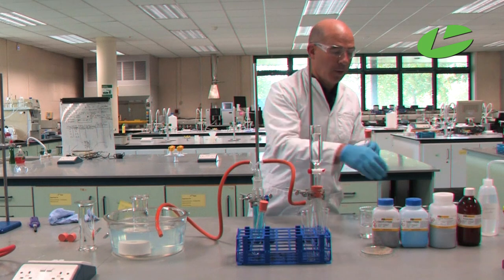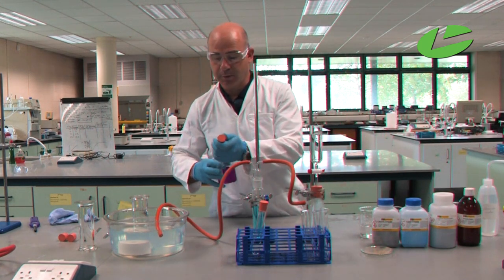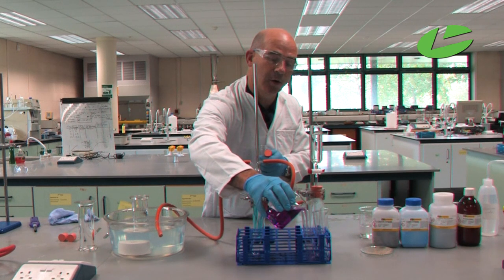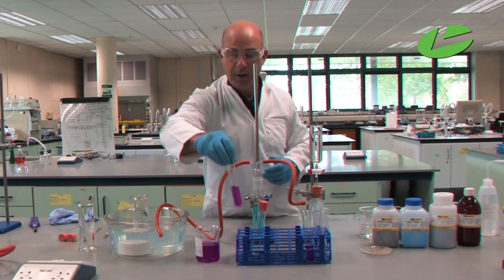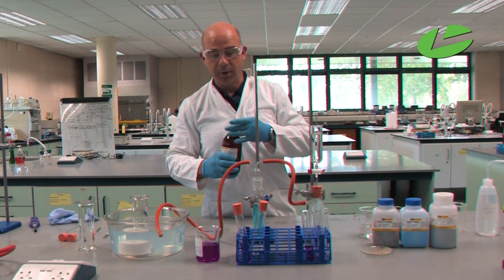For the tests we use test tubes. In test tube one I'm going to put acidified potassium permanganate — the purple solution. It's also advisable to have a reference test tube so you can see the colour before the reaction. That's the potassium permanganate test solution ready. Then with bromine water, I'm going to put it into a second test tube.